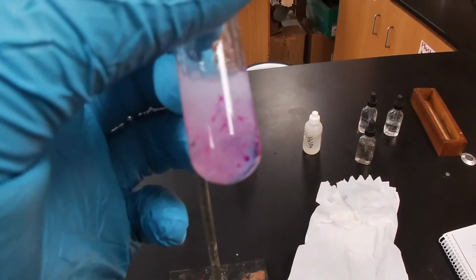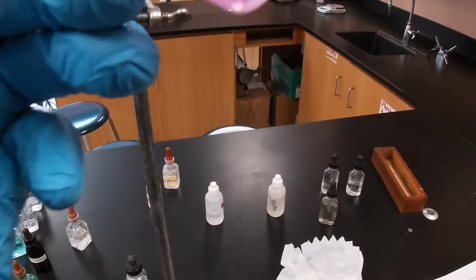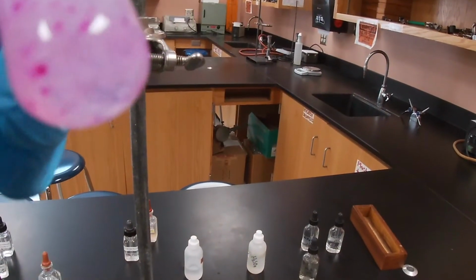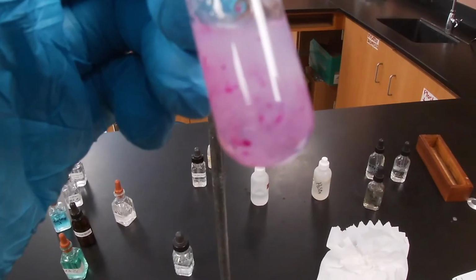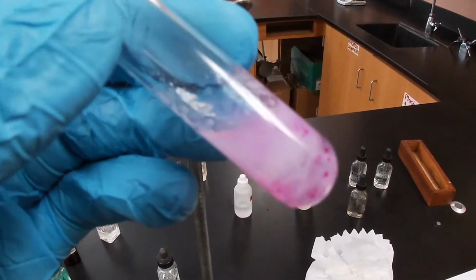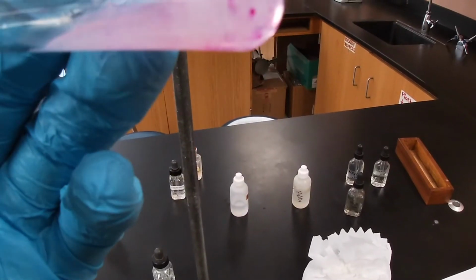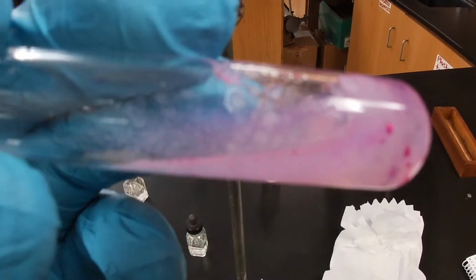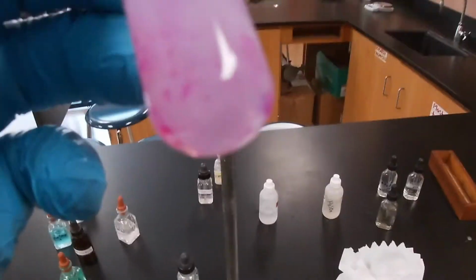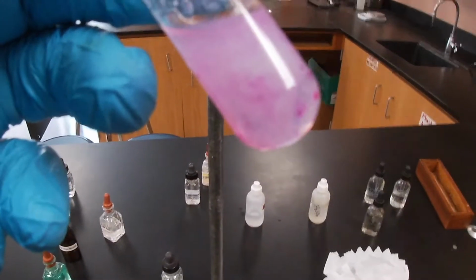And so here, as you can see, a little jelliness, right? So a big, thick precipitate. Little pinkish globules, right? Very thick. It did, as you can see right there, hopefully. The precipitate is a rather thick, almost gelatin type. All right.